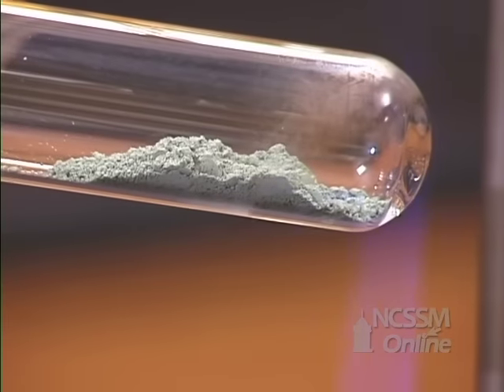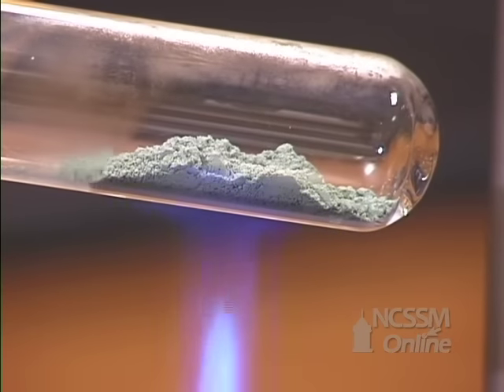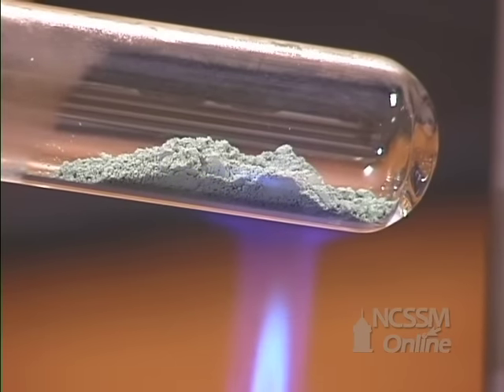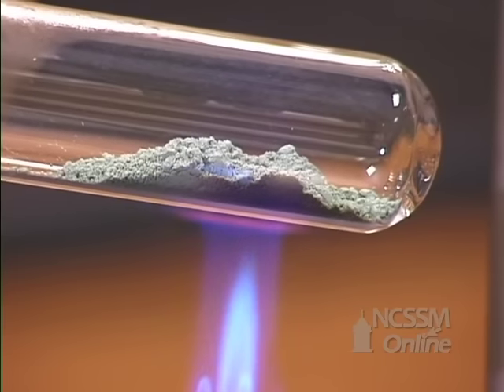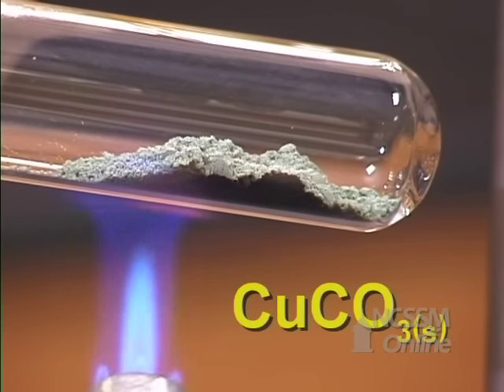When you heat a metal carbonate, the metal carbonate decomposes to give carbon dioxide and the metal oxide. We will heat a sample of copper carbonate.